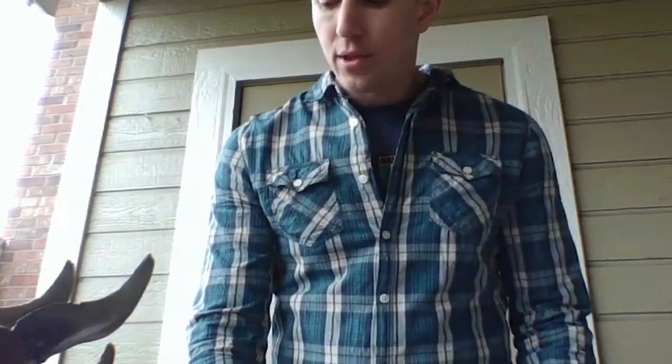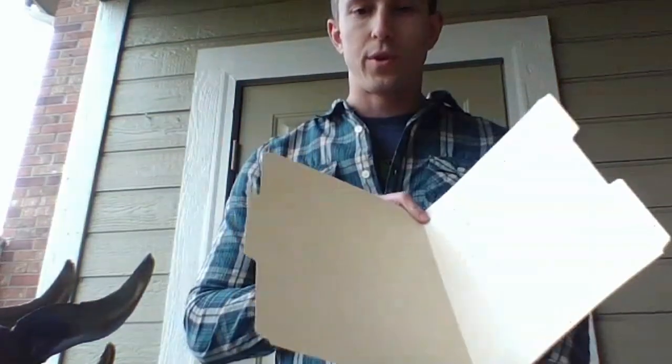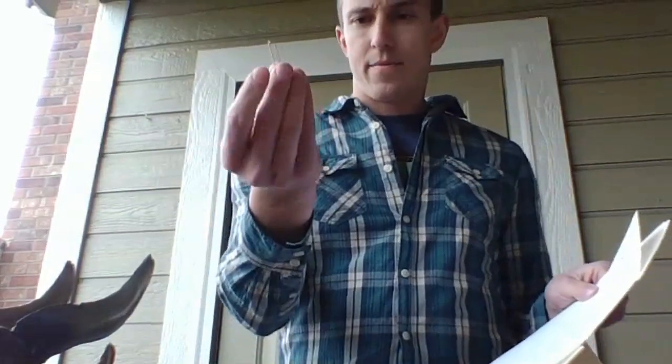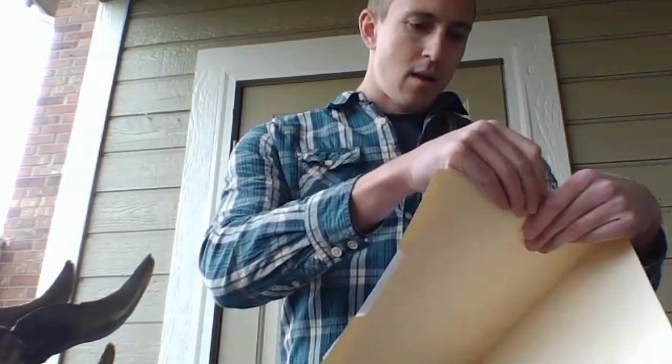What you'll also need is a way to fix that paper so that it doesn't move. So I'm just going to use this little manila folder here. You're welcome to use anything that you have at your disposal. And then you're going to need a way to attach your sheet of paper to your folder, or whatever you're going to use. I've just got a paper clip right here, so I'm literally just going to clip it on there. And voila, good to go.